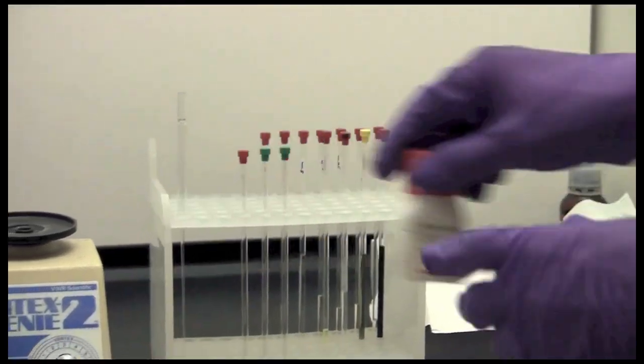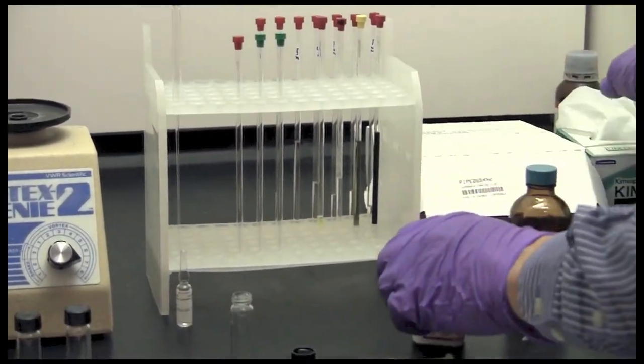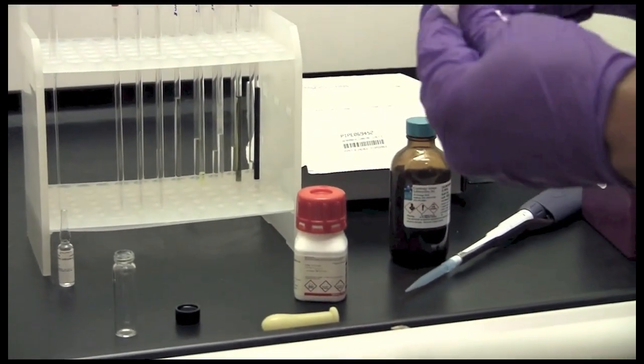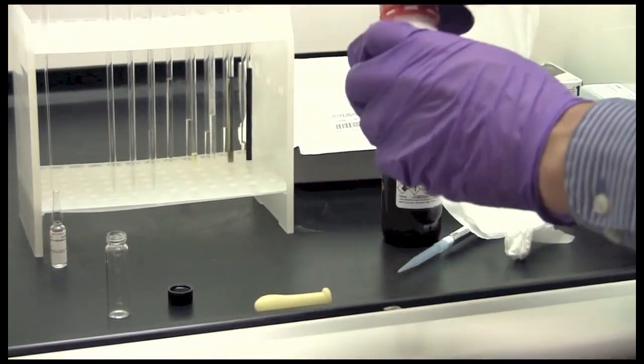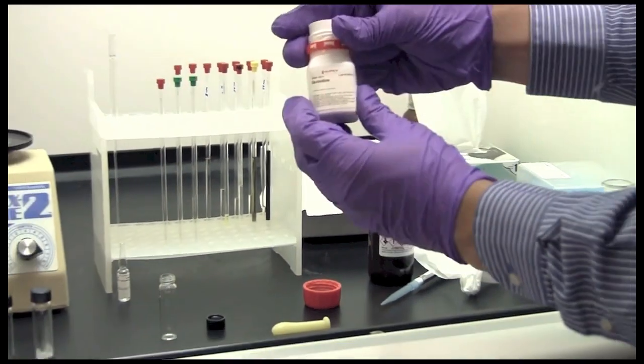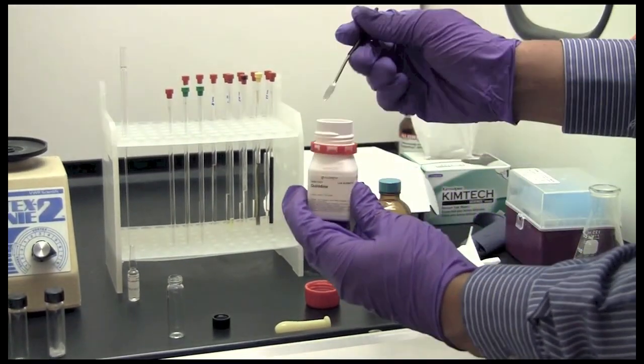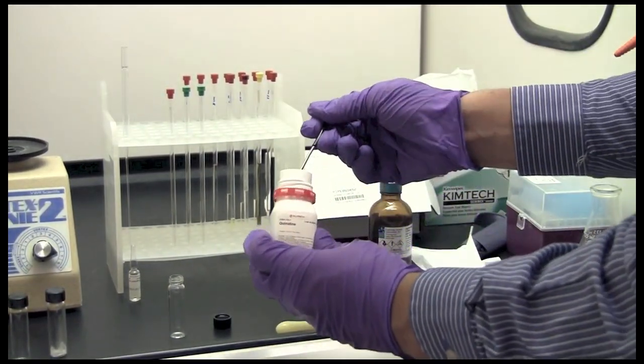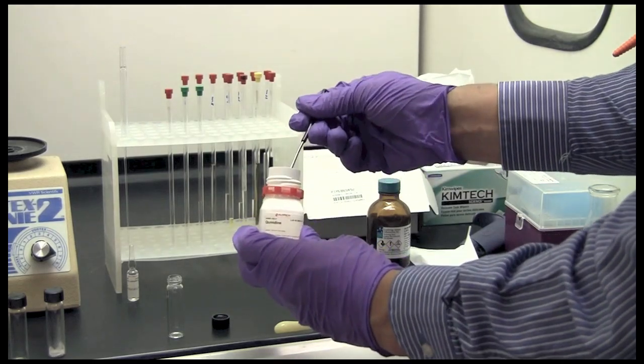So I am going to prepare a sample, I am going to wipe down a spatula and take a small amount of a sample, in this case it is quinidine, just a standard material for testing, and I will put a little bit into a vial.